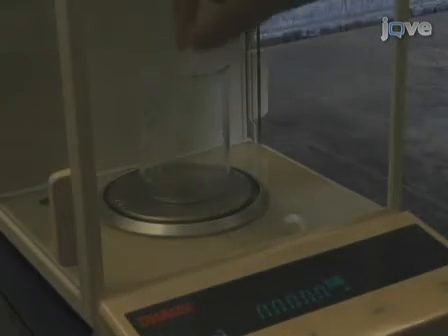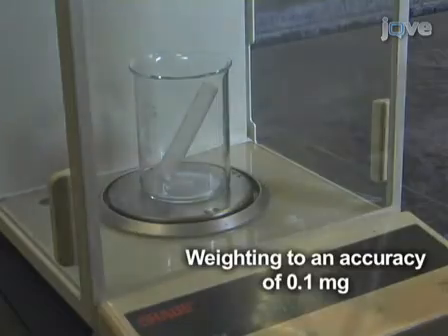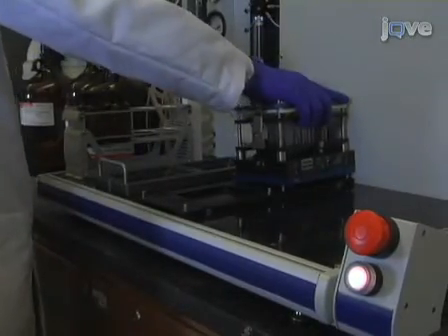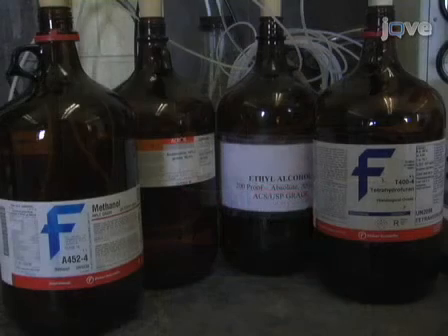The first step involves weighing the empty tubes to an accuracy of 0.1 milligrams. The MiniBlock is then sealed shut and mounted onto the liquid handler deck. There are 4 reagent bottles and 4 solvent bottles used in this experiment.